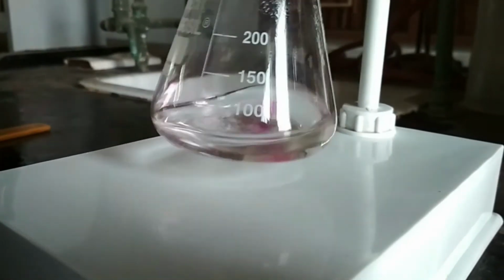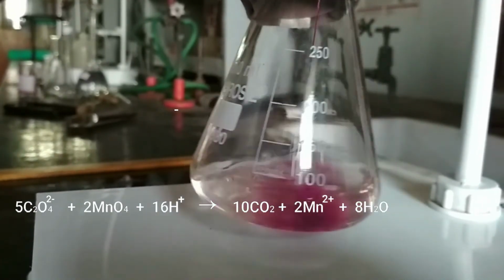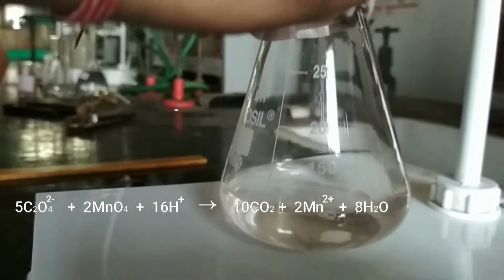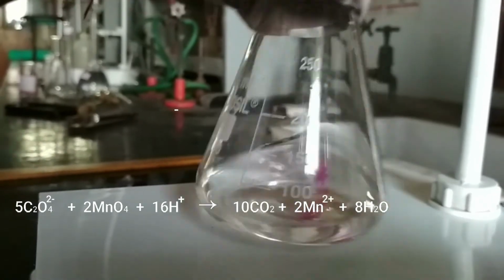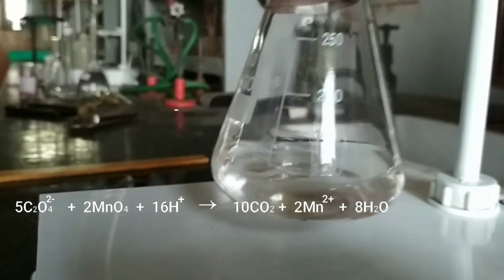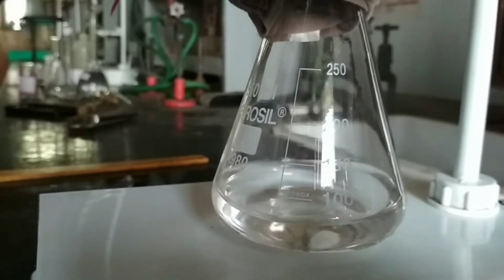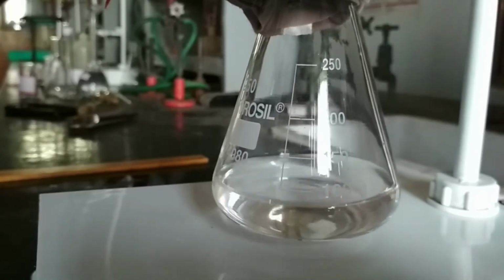The overall reaction is shown here. Oxalic acid is transformed to carbon dioxide and permanganate is transformed to manganese 2 plus. This reaction is very slow at the beginning, if it spontaneously takes place.